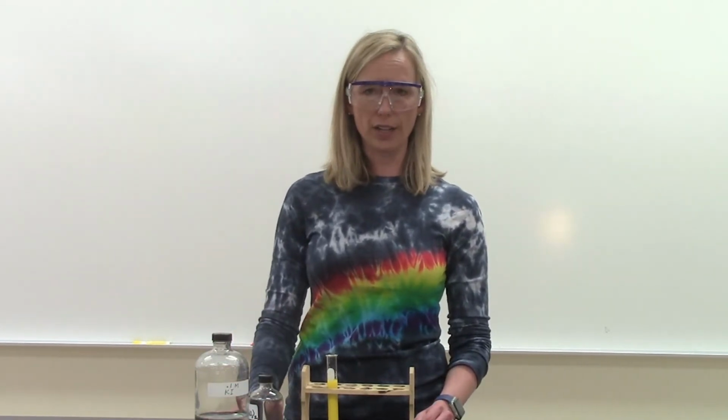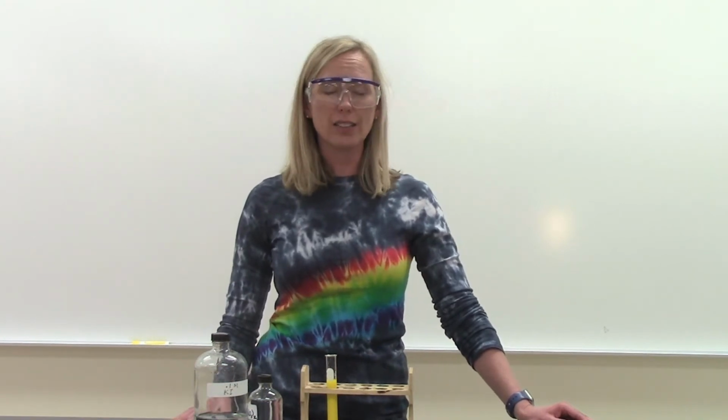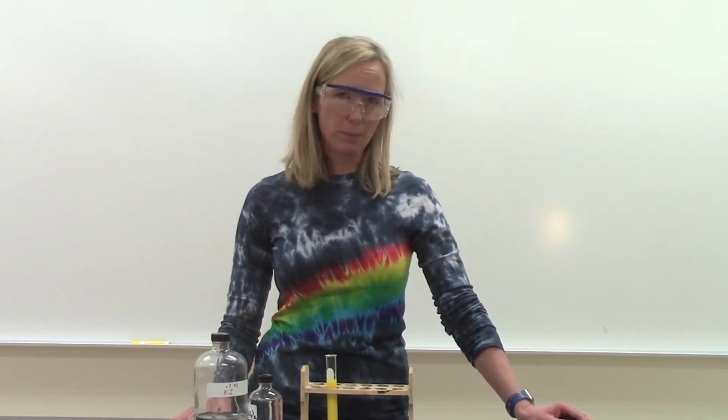This chemical reaction is an excellent example of a double replacement. We had two compounds that were dissolved in water, and we create two compounds as our products. One of them happens to be an insoluble compound, which we call a precipitate, and the other compound is actually soluble in water. So let's take a look at the formulas of the reactants and products and see if we can figure out what that precipitate actually was.